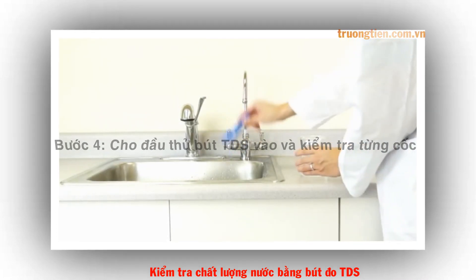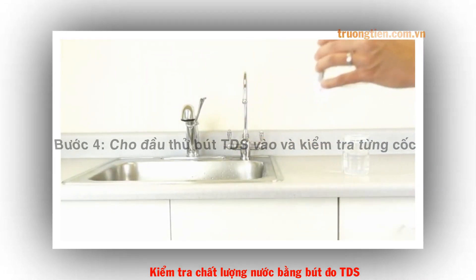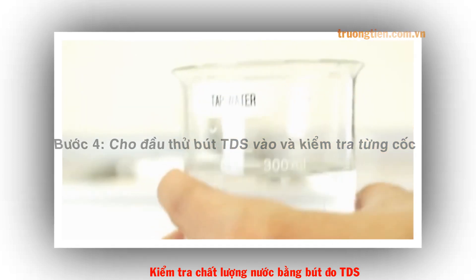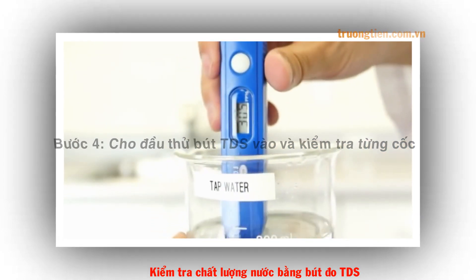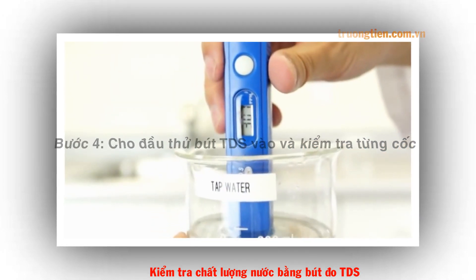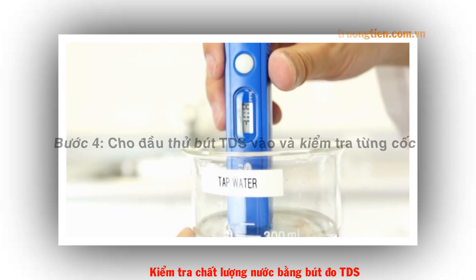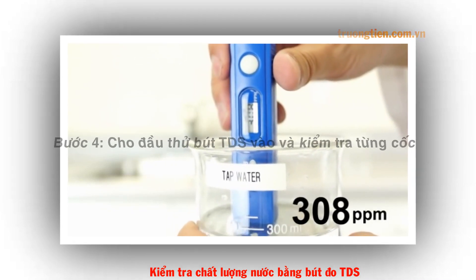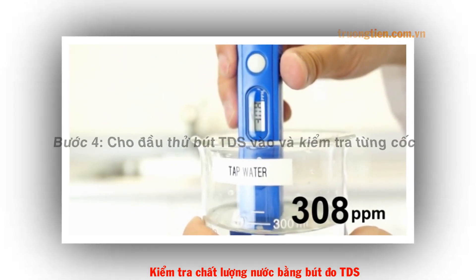Shake off any excess water and then test the tap water the same way. The meter shows 308 parts per million.